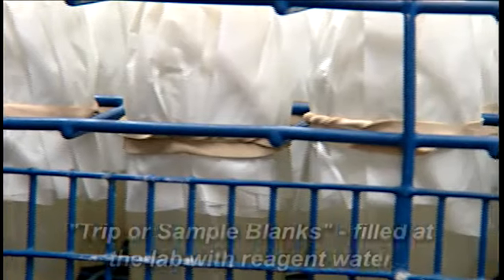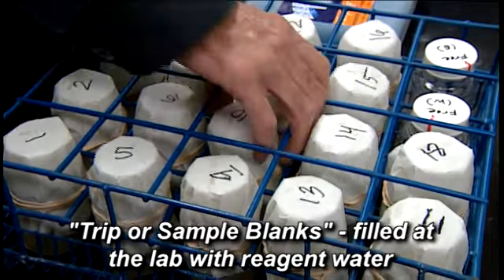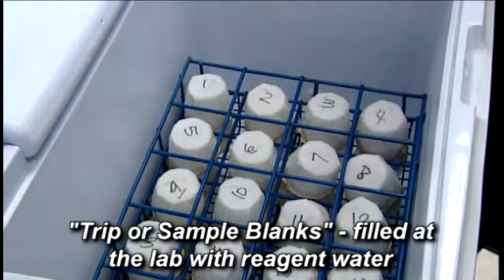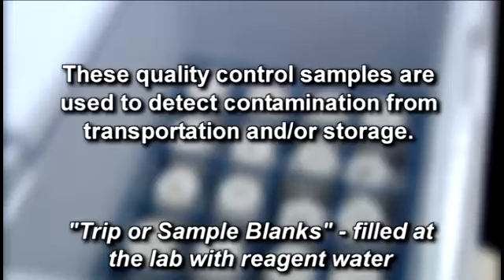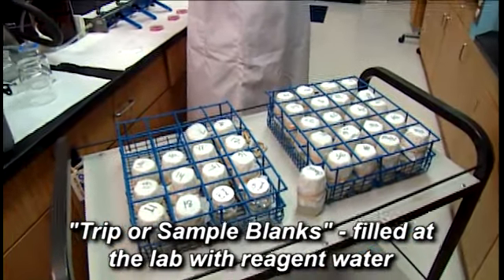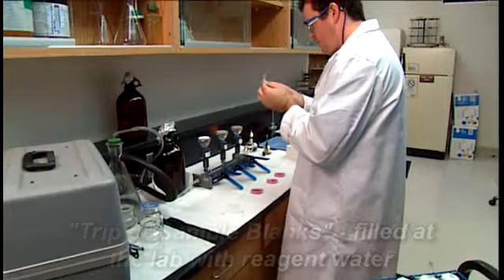One way of ensuring sample integrity is through the use of sampling blanks. Trip blanks are water samples taken from the laboratory to the sampling site and returned to the lab without being opened. These quality control samples are used to detect contamination from transportation and/or storage. Trip blanks are a critical aspect of sampling because, when processed accurately, a trip blank ensures that primary samples were not contaminated during transportation.